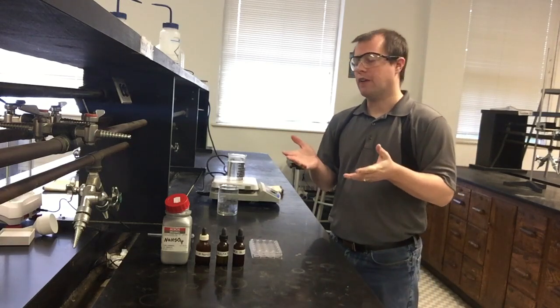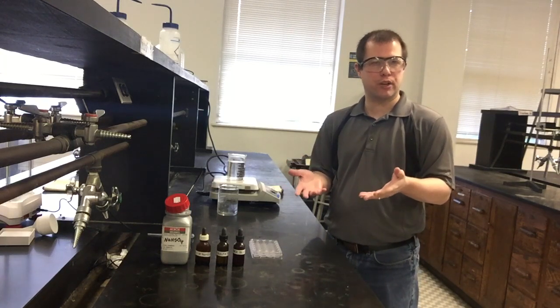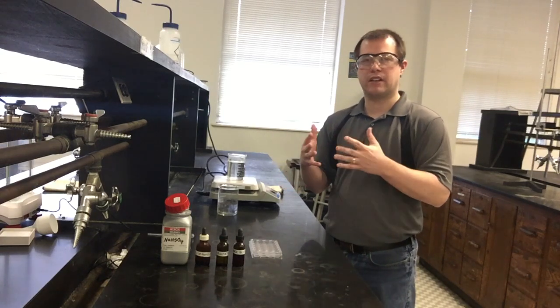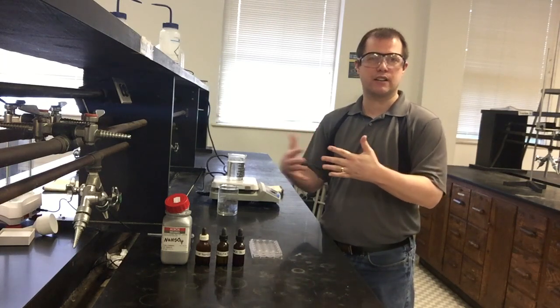I'm Dr. Meyer. This week we're going to be taking a look at Le Chatelier's principle and really the idea of chemical equilibrium. The lab itself actually isn't too terribly long, but there's a lot of theory to this that we want to understand and make sure hopefully you guys are thinking about as you see the different components of the experiment.